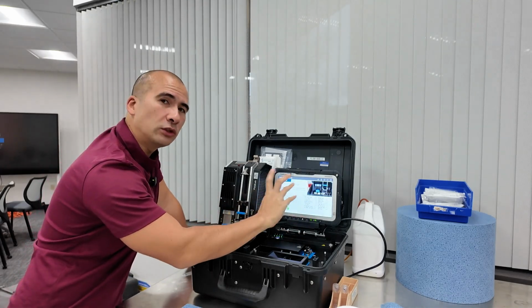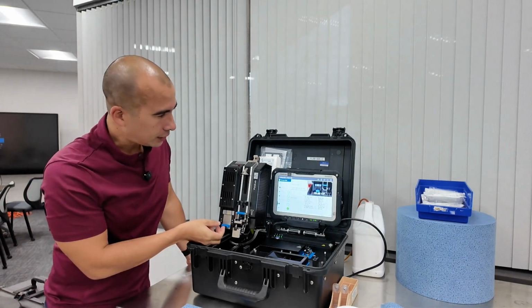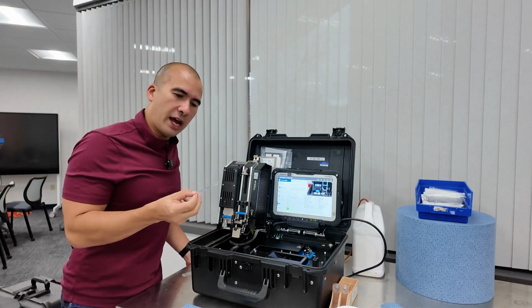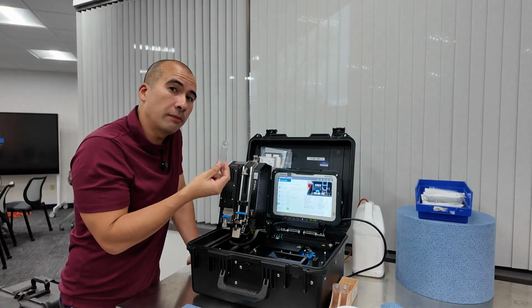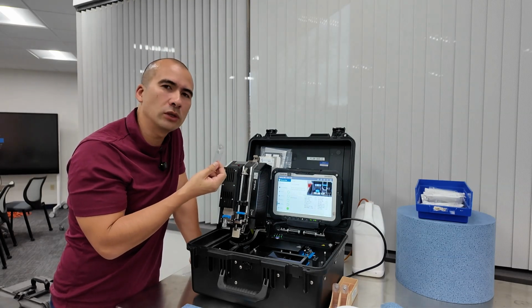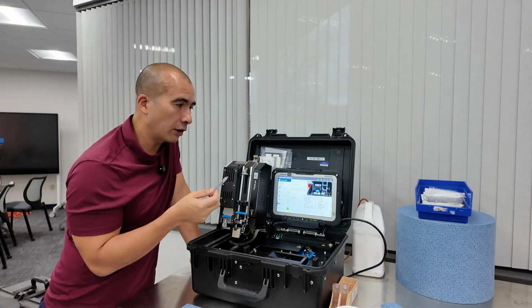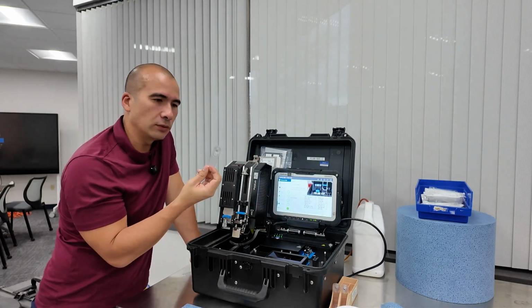And now what this is really, really useful for is, number one, we can take out this little unit. And because we have a prepared filter patch, we can actually do some, for example, analysis through a microscope, in a similar way to what you'd do a filtergram or a ferrogram. So it gives us that capability. Because these are very repeatable, it's also calibrated for the XRF, and we are getting these elemental results.